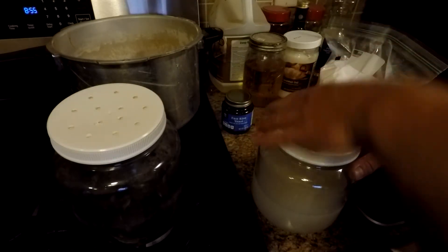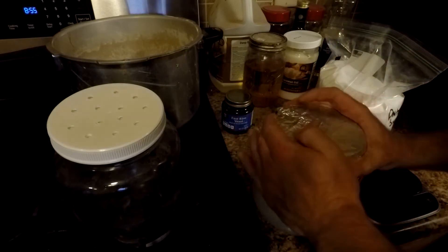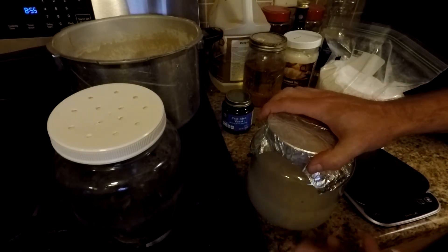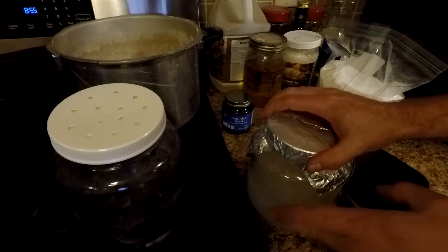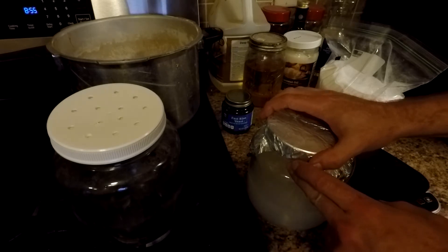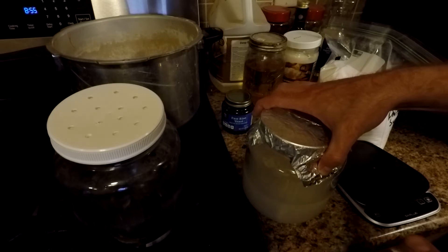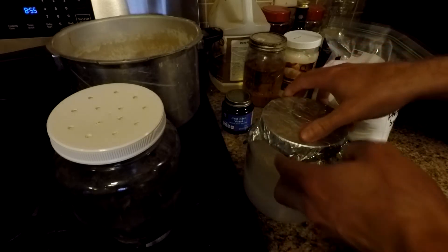Because the small cooker can really only hold one jar at a time, I'm going to do two jars in separate runs. I want one jar to be fully cultured and stored as a backup master in my fridge, and then I'll make another liquid culture master that I'll pull from to start making grain bags. Hopefully I won't need to use these much because I'm going to try to get spores from some old King Oysters and get my own culture going off a spore print.